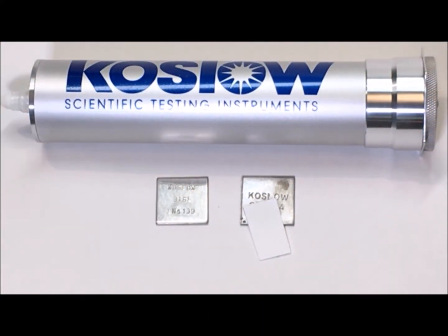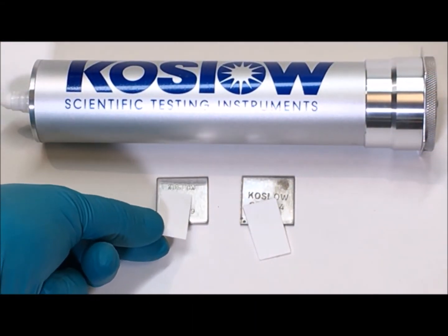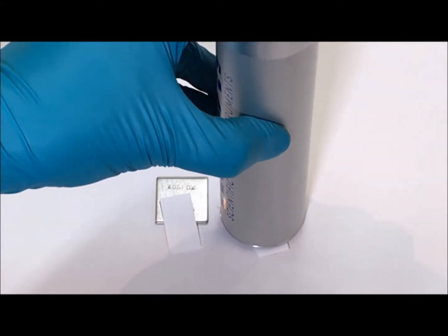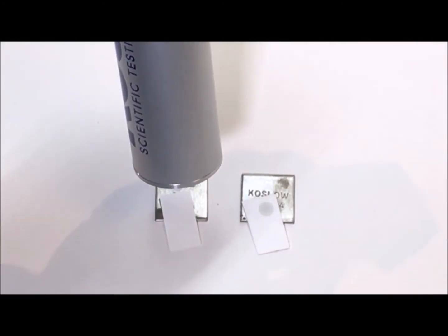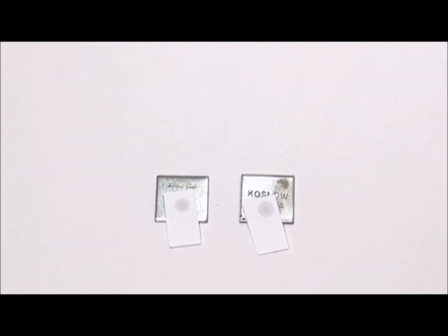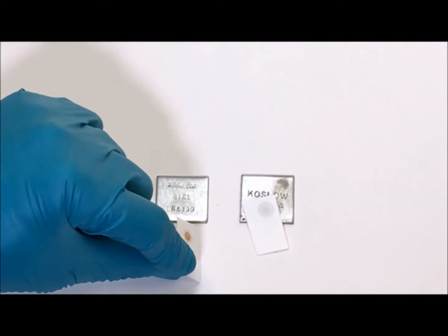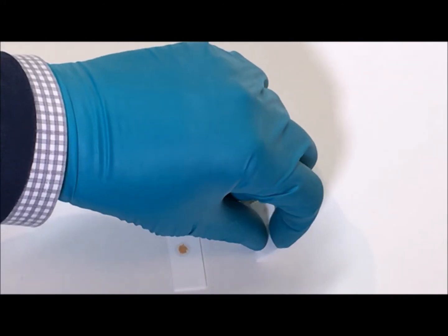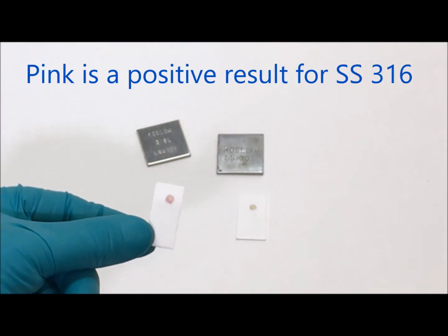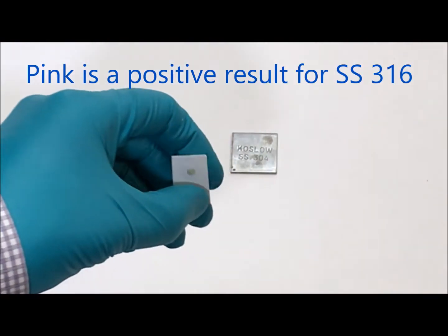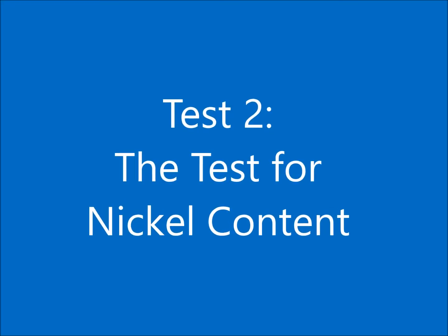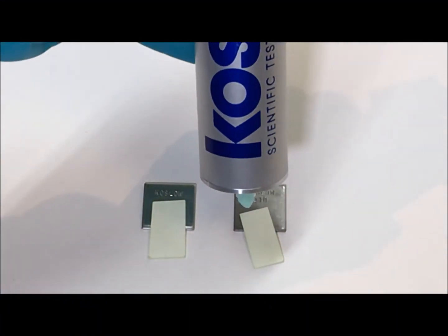Put your test strip on the metal sample. Only one second is needed. Let me zap it for one second.